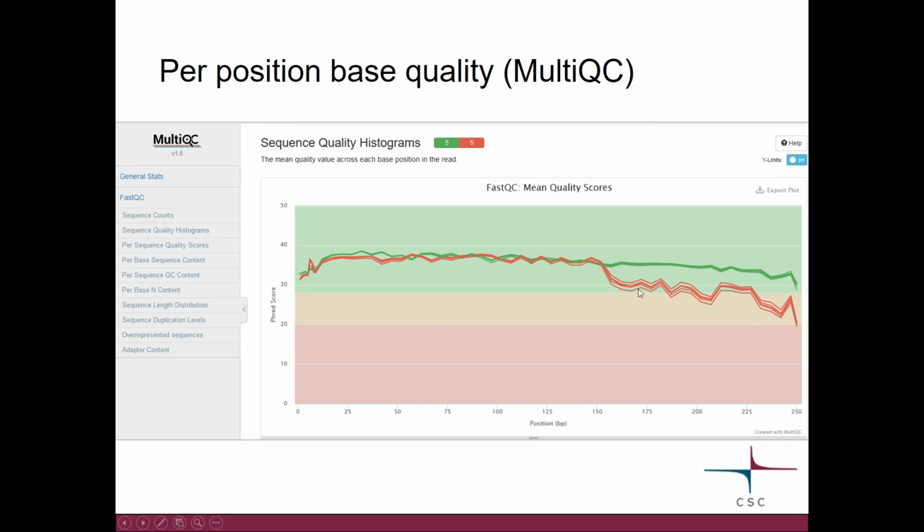Now each line is the base quality indicator for that particular position in that particular sample. And here you have the quality score, and again the background is colored green, orange, or red. You can see that MultiQC decided that 5 files are okay in terms of base quality, and then 5 have lesser quality. So these are these ones here. And otherwise you have exactly the same type of plots as you had for FastQC that we looked at earlier.